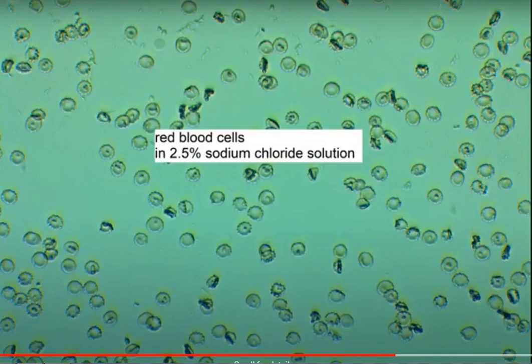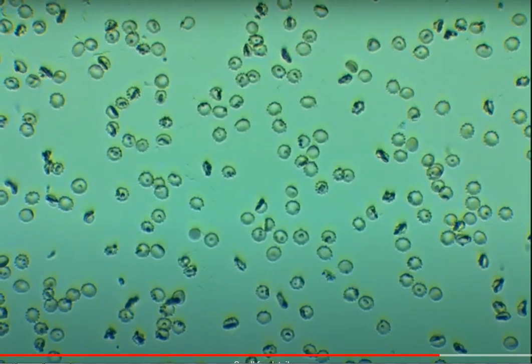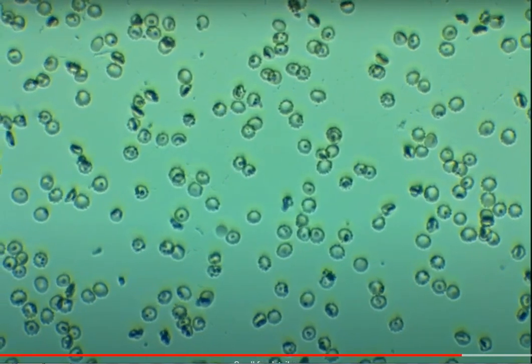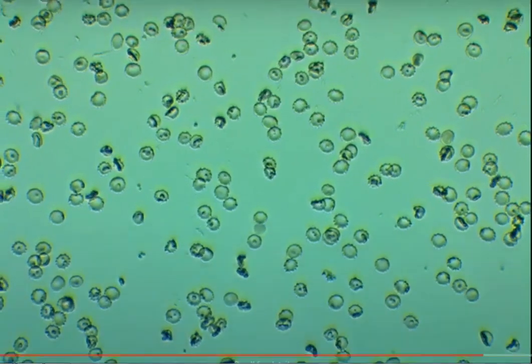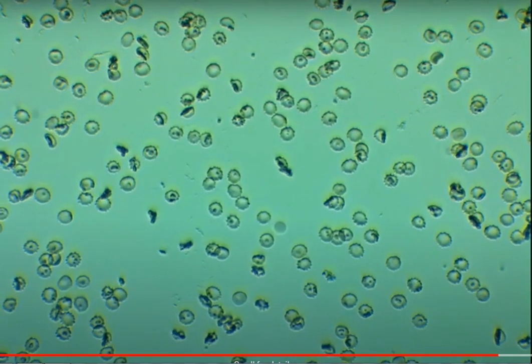This time around, we don't have the 5% sodium chloride solution, but 2.5% sodium chloride solution is still higher, more concentrated compared to your 0.9% sodium chloride solution. So, what can you say about the morphology of your red blood cells when they are placed in 2.5 or 5% sodium chloride solution?